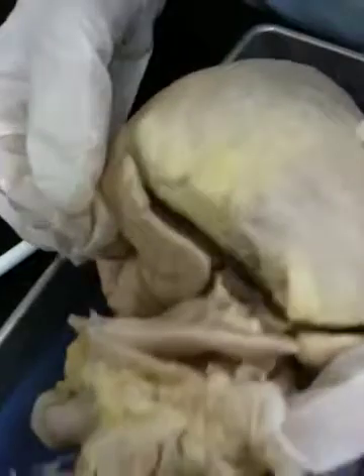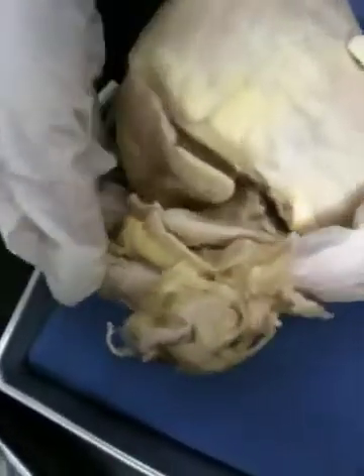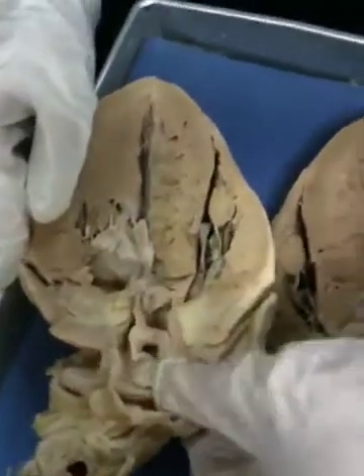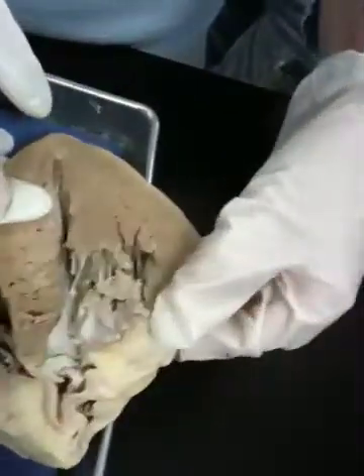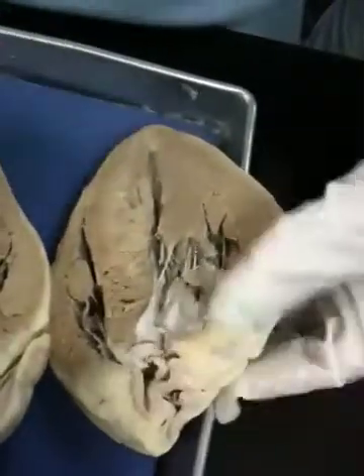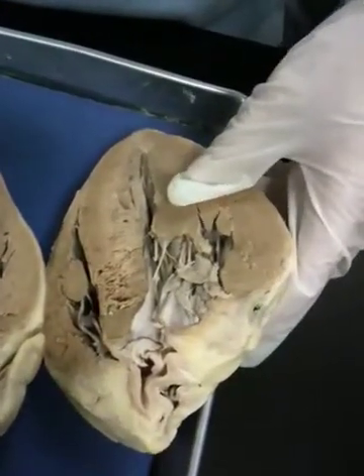Is the pulmonary trunk always below the aorta? You can look at the opening — like this is part of the aortic arch. It's pretty guaranteed that you'll see an aorta; you may or may not see the pulmonary trunk. On this side, it's basically a mirror image. Here's more of the aorta and the other side of the semilunar valve. I did see a pulmonary semilunar valve on one of these other hearts.